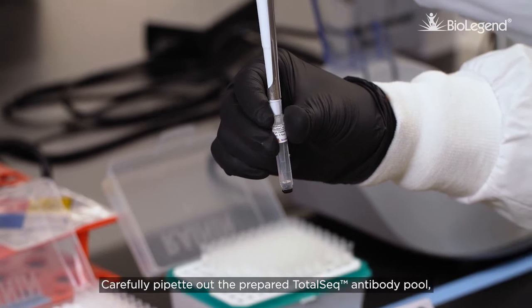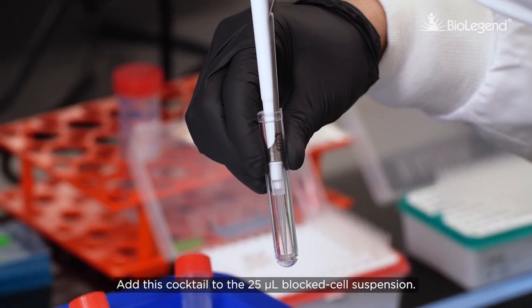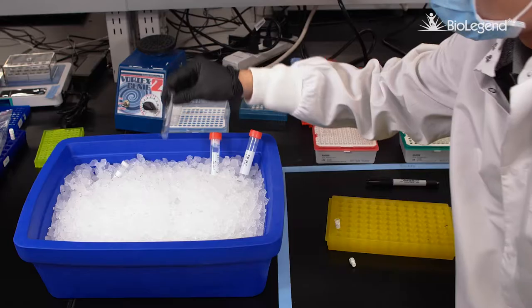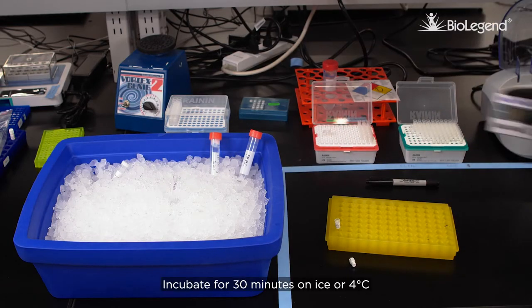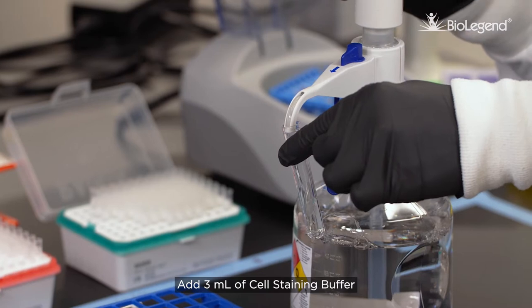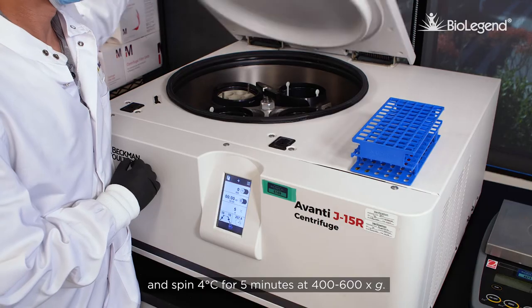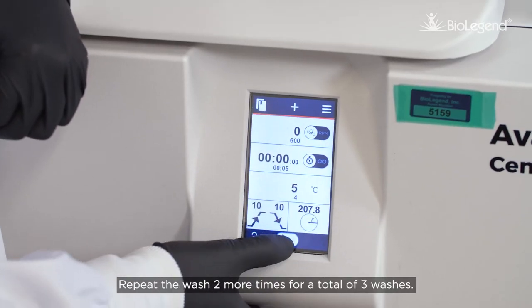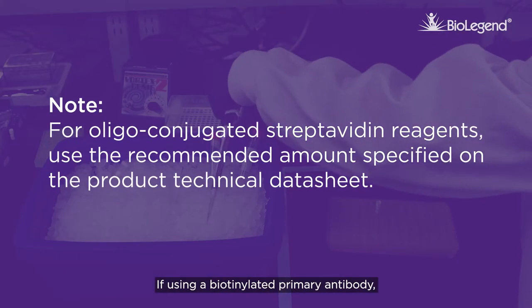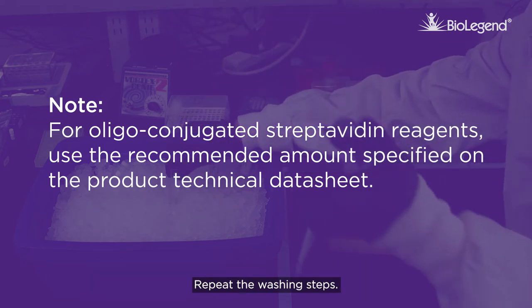Carefully pipette out the prepared TotalSeq antibody pool, avoiding the bottom of the tube. Add this cocktail to the 25 microliter blocked cell suspension. Incubate for 30 minutes on ice or at 4 degrees Celsius. Add 3 milliliters of cell staining buffer and spin at 4 degrees Celsius for 5 minutes at 400 to 600 G. Repeat the wash 2 more times for a total of 3 washes. If using a biotinylated primary antibody, incubate the stained cells with the appropriate oligo-barcode-coated streptavidin for 20 minutes. Repeat the washing steps.